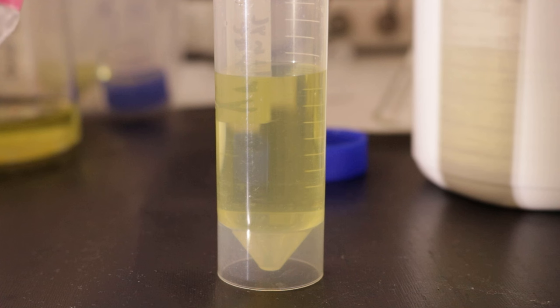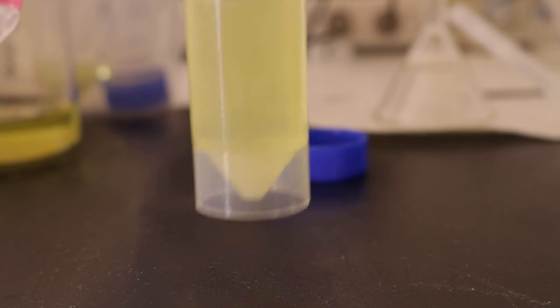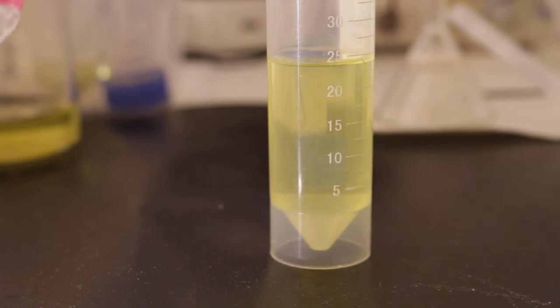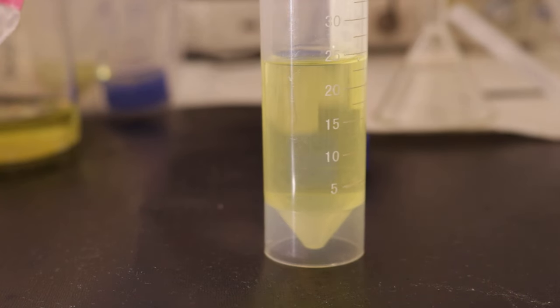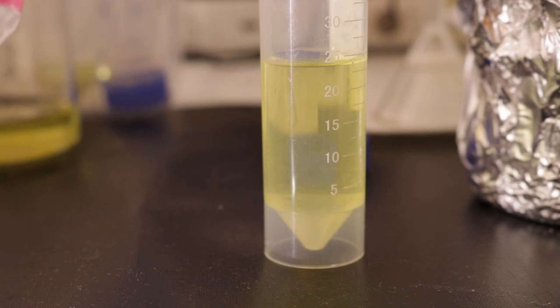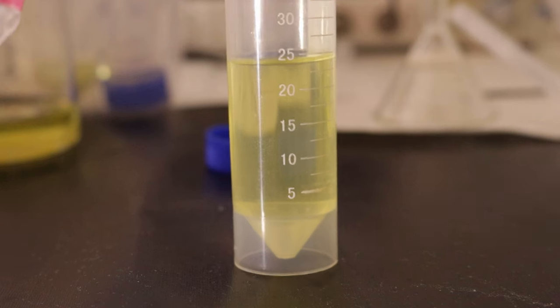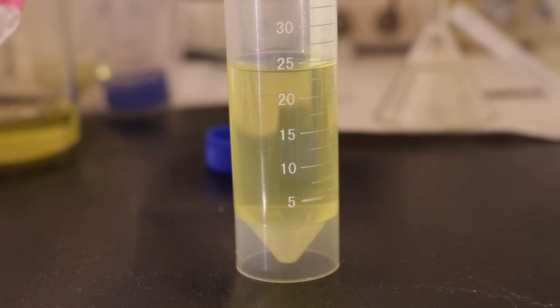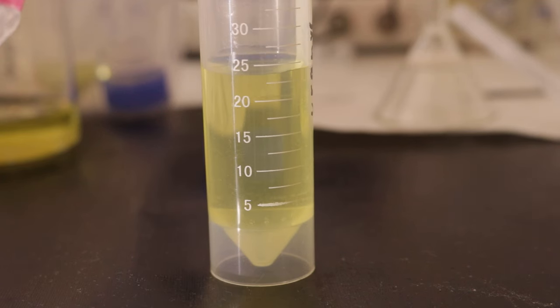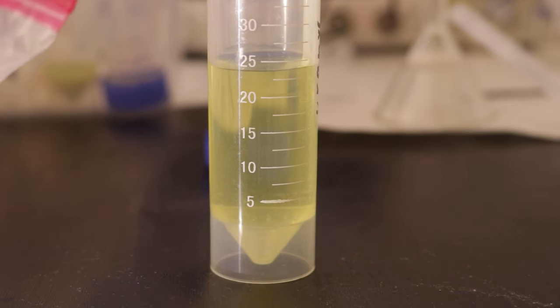Adding just a tiny little bit of barium. Some of it is not dissolving. I'm going to add a little bit of nitric acid. That's really strange. It already has a precipitate at the bottom, and it seems to be a bit more radioactive than the rest of the solution.